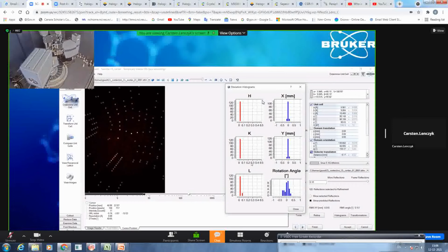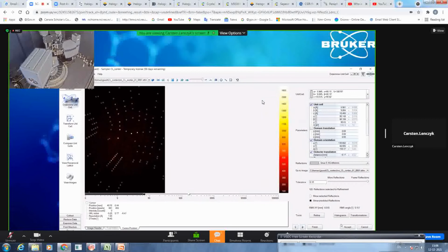The same is in the reciprocal space. So here you see, because the HKLs are always integers, they should always be at the intersections of the grid. So here you always want to have them as close to 0 as possible. So overall, with this information and this information, you get the very good feedback that the crystal we are currently using has very good quality.